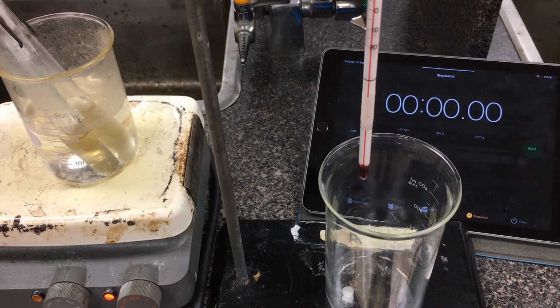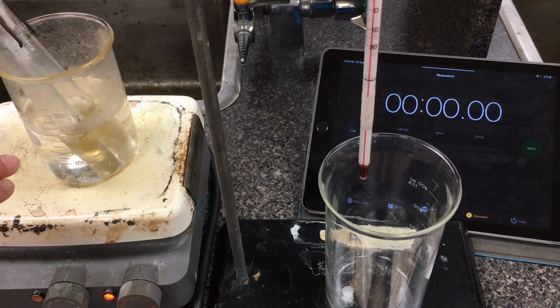Okay, so in this lab here, we're going to be taking down some temperature time data to analyze what's referred to as a cooling curve and a melting curve. The chemical that we're working with here is stearic acid. It's already been sitting inside this boiling water for a little bit. What we want to do is liquefy it at first. We're going to analyze the cooling curve first, and then putting it back into a hot water bath, we can analyze the melting curve afterwards.